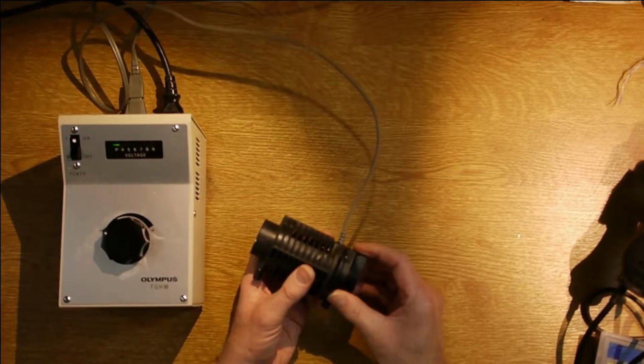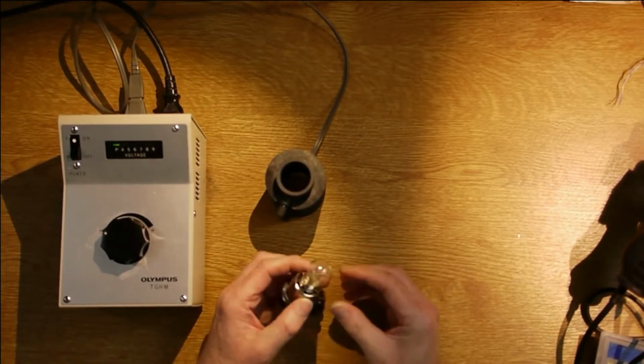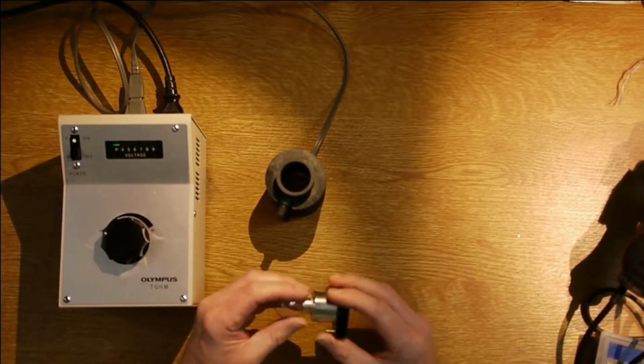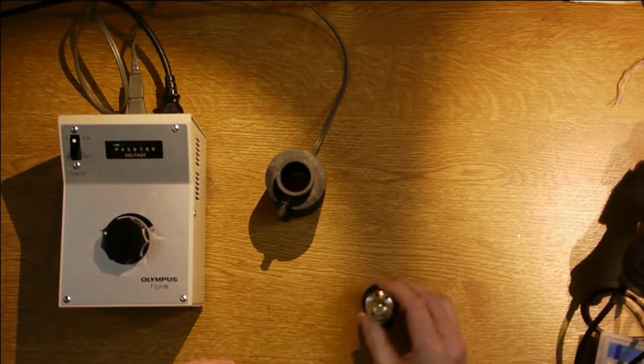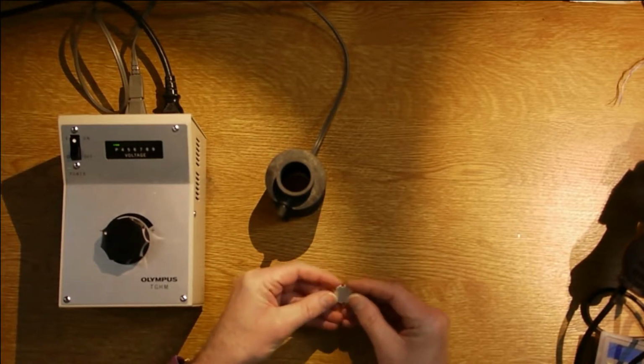So I decided to replace that part, leave everything else the same, so I'm not going to change the microscope. I think this bulb was just an automotive bulb that someone's put into that holder, so I don't think that's the proper bulb. It might be, but I don't think it is. So what I did was I decided to use these Cree LEDs.